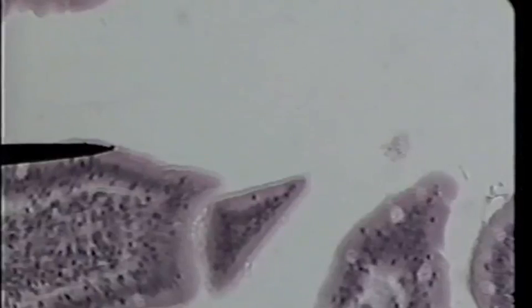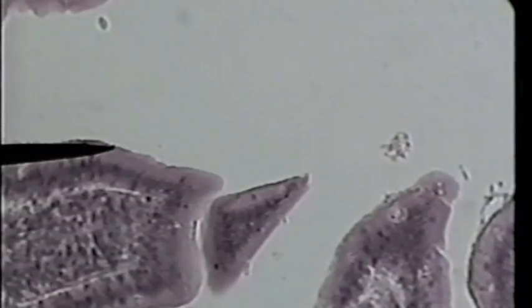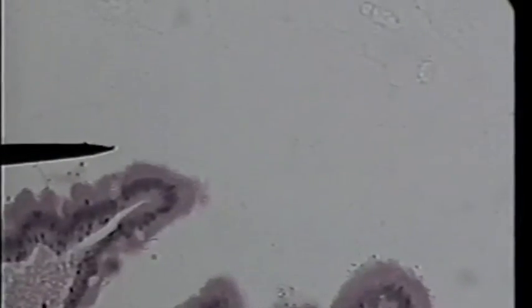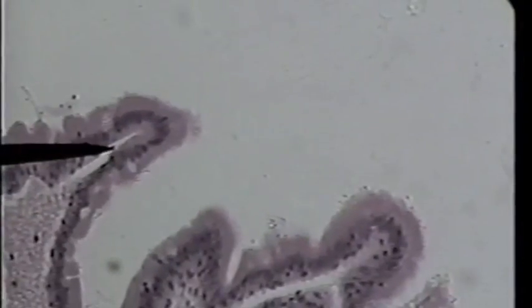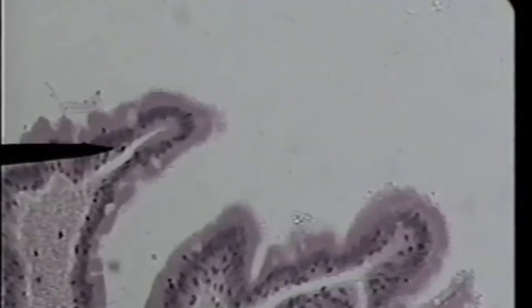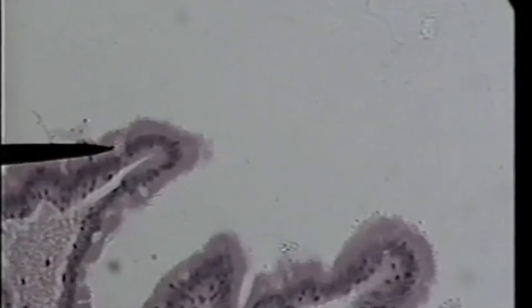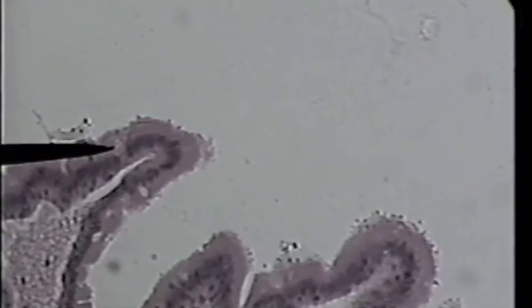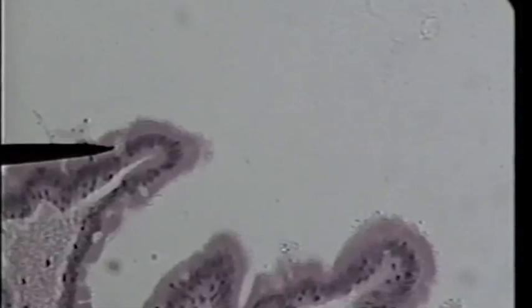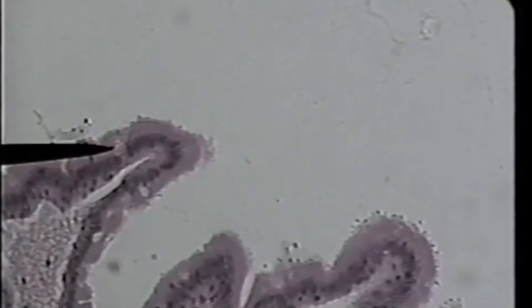The pink layer or cytoplasm is near the lumen. The simple layer of columnar epithelium lines the small intestine. Here is another view of the same slide — another layer of simple columnar epithelium visible, with the dark line of nuclei and the pink layer of cytoplasm. The tip of the pointer now is at a goblet cell. The goblet cells are filled with mucus and are found within the simple columnar epithelium of the small intestine.